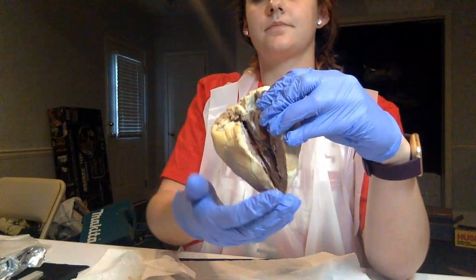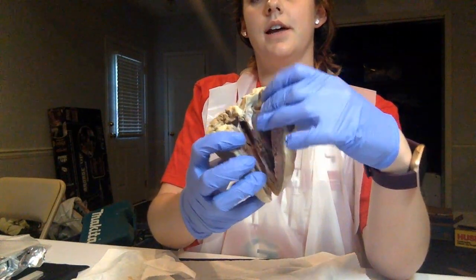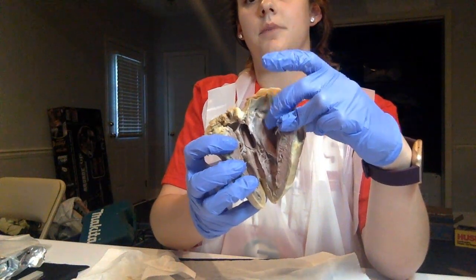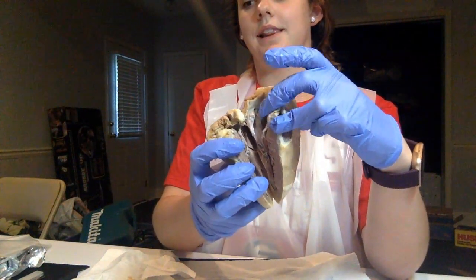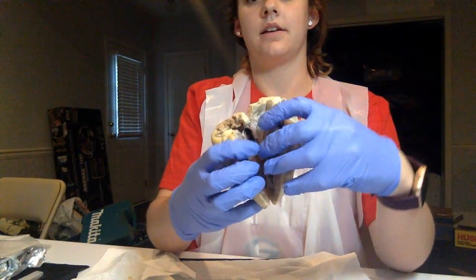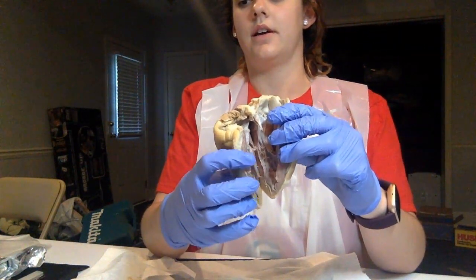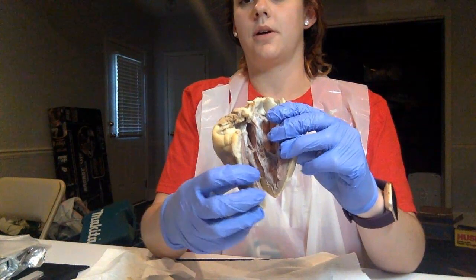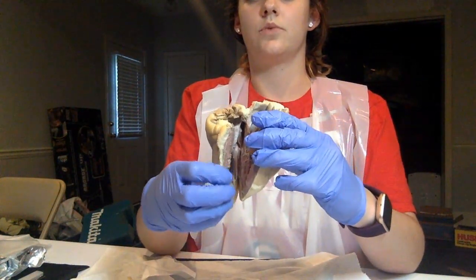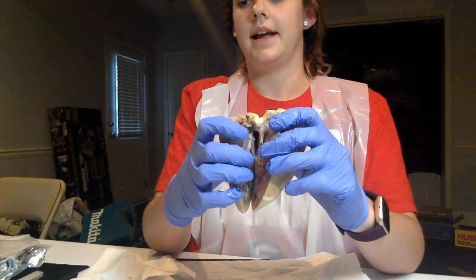and then kind of more in the middle is where we have the interventricular septum, and here's the apex, and then over here is where we have our left ventricle, and then you can see more of the chordae tendineae up here, and then the bicuspid valve, and then up here is the left atrium, and then over back on this side we have our endocardium, our myocardium, and our epicardium, and the epicardium's kind of more towards the outside on this side of the heart.